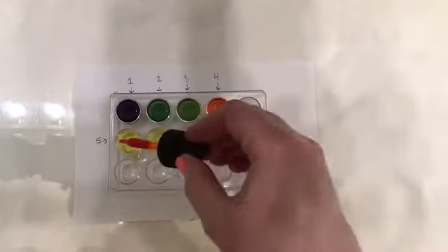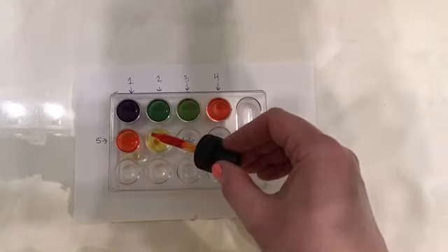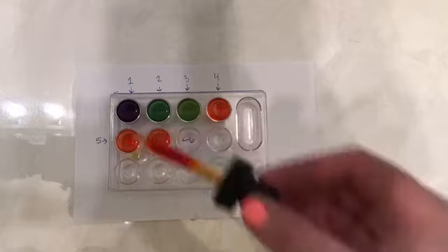Oh, kind of orange reddish. Yeah, definitely. Suspect number five. Orange as well. Oh, interesting. And finally suspect number six. Another orange, red orangeish color. Okay.